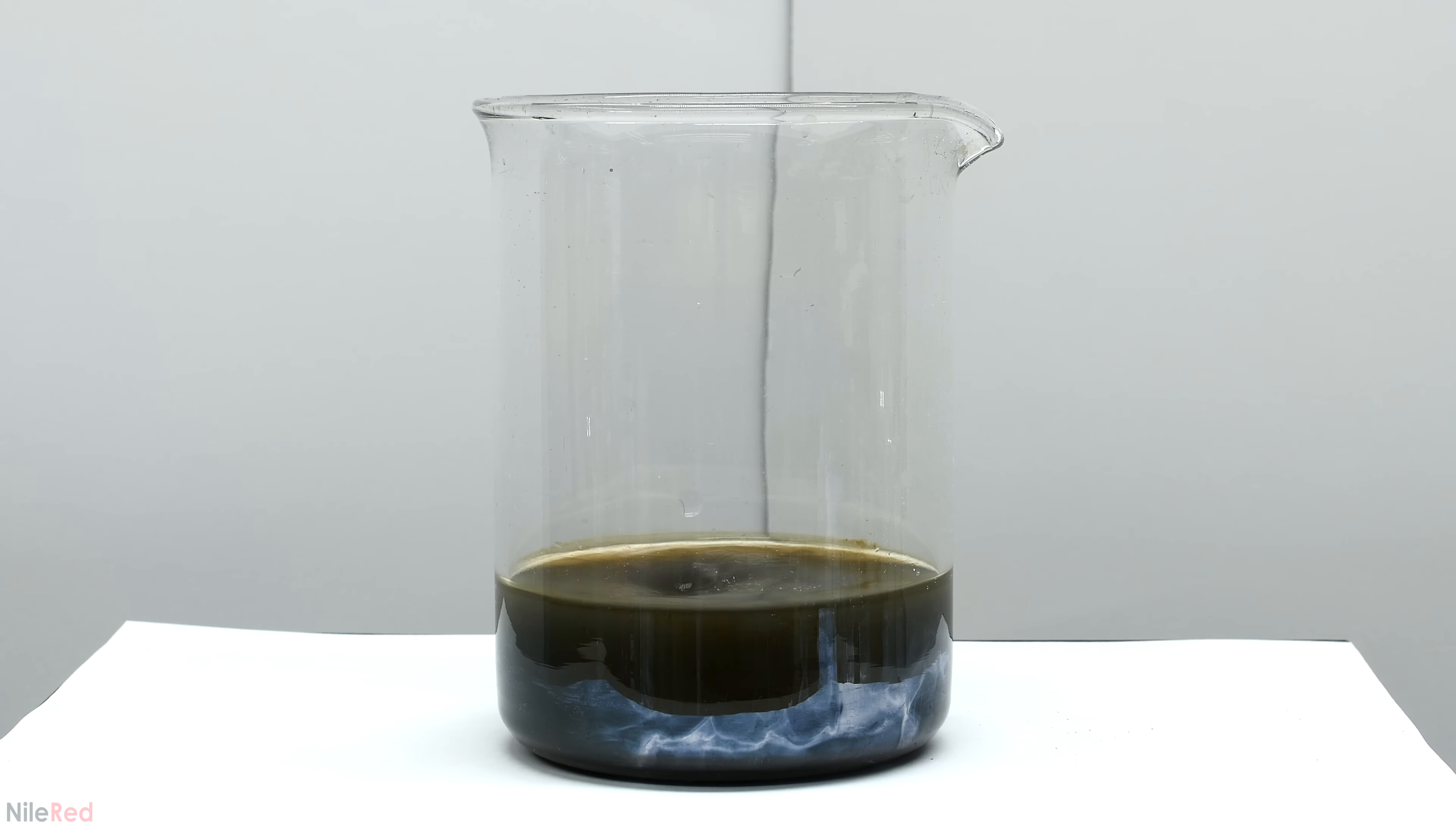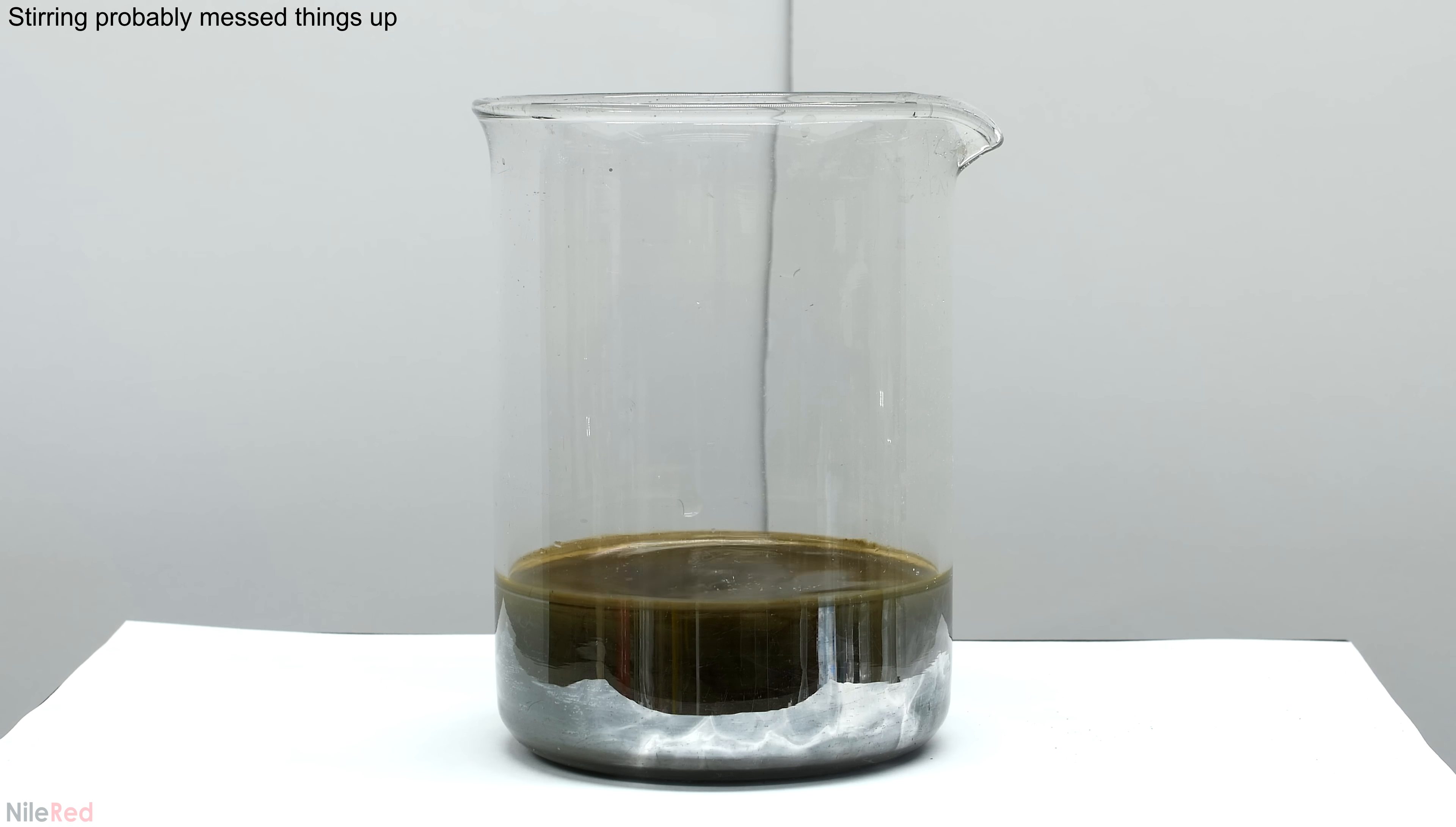In the silver mirror video by NerdRage, he was able to cover a glass slide with silver and make a small mirror out of it. I'm not exactly sure here why it didn't work for my glass stopper, but maybe I just didn't leave it in the solution long enough. Also, NerdRage used heat which increases the rate that the silver mirror forms, so maybe that helped out too.